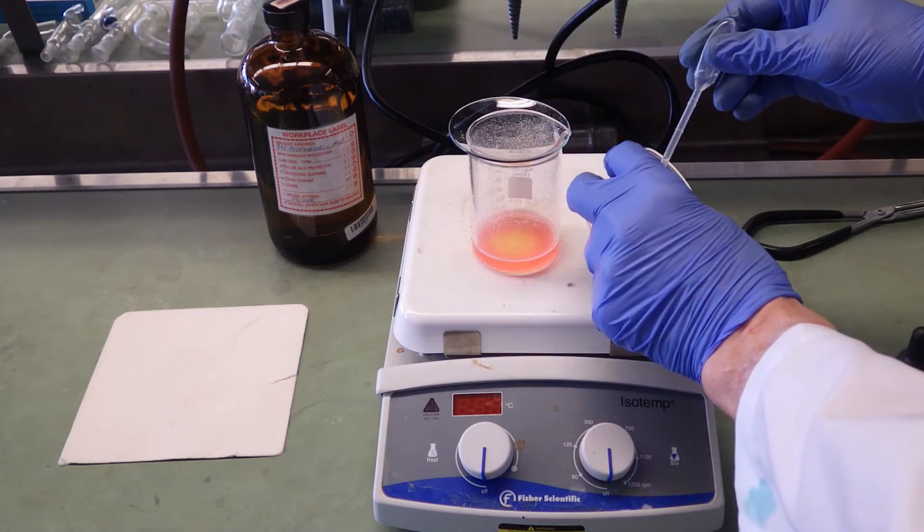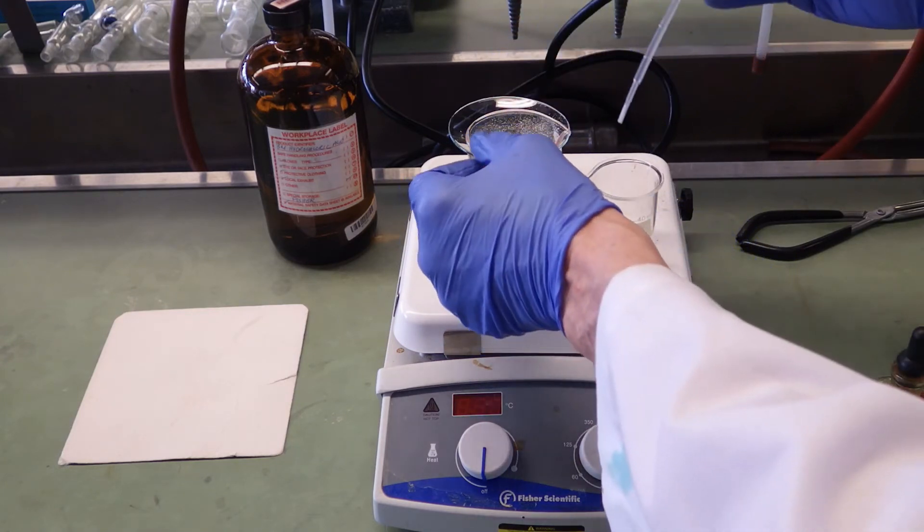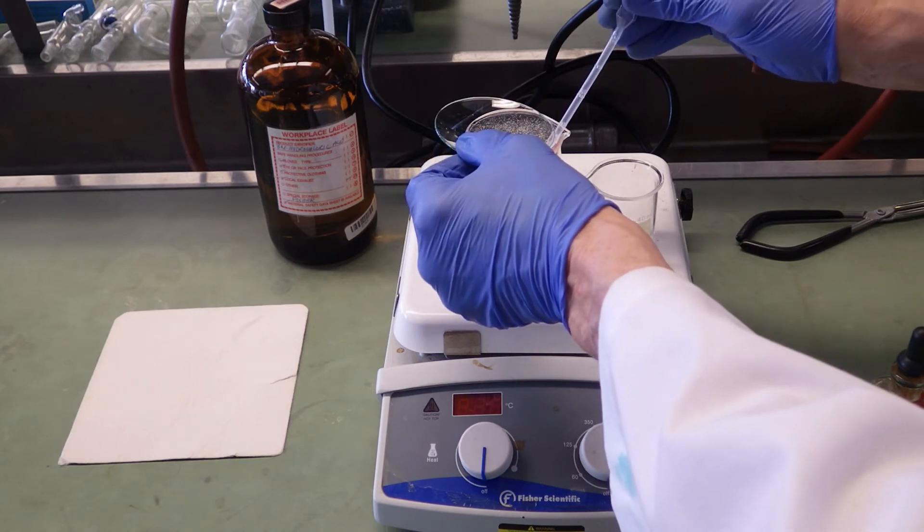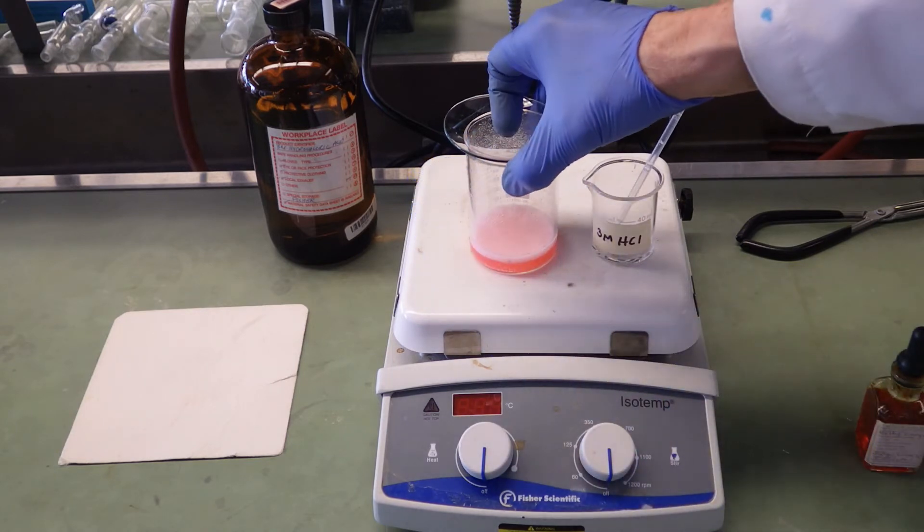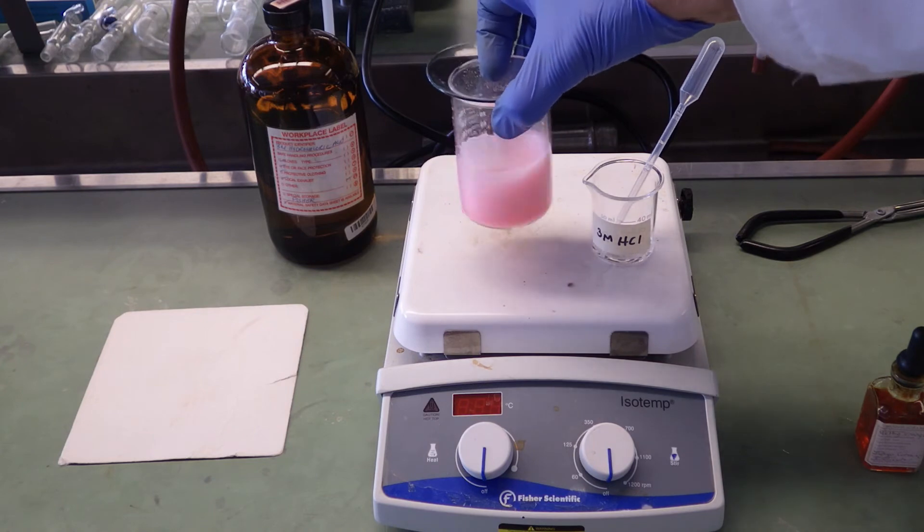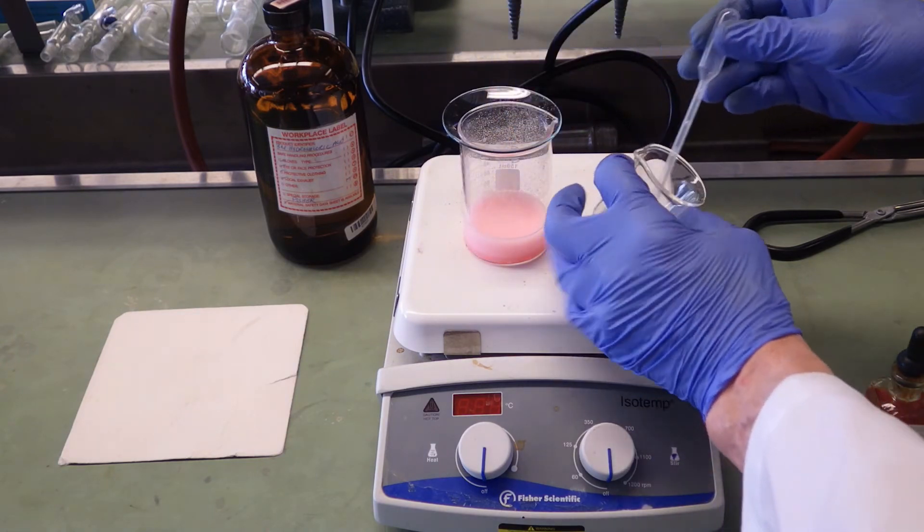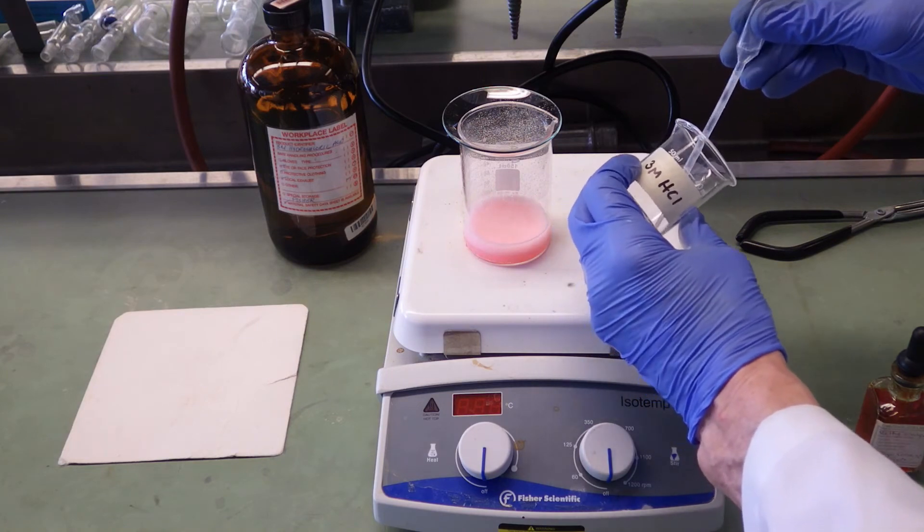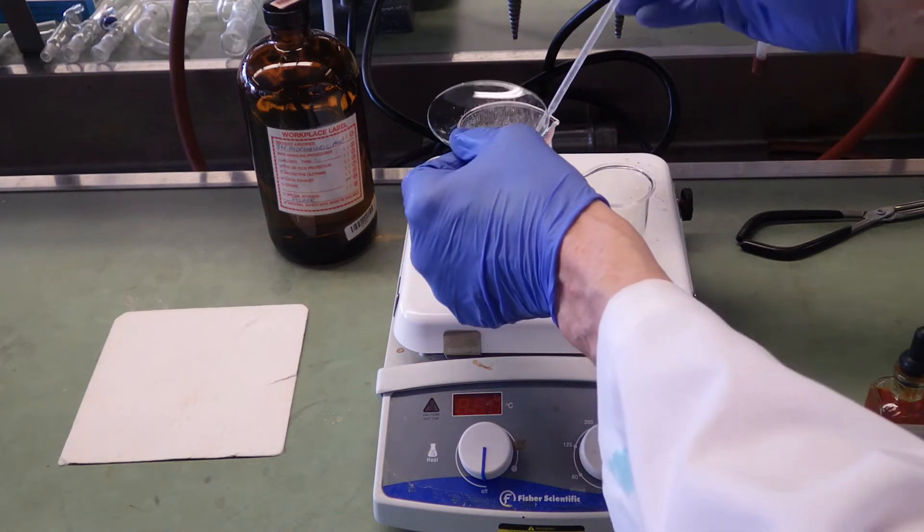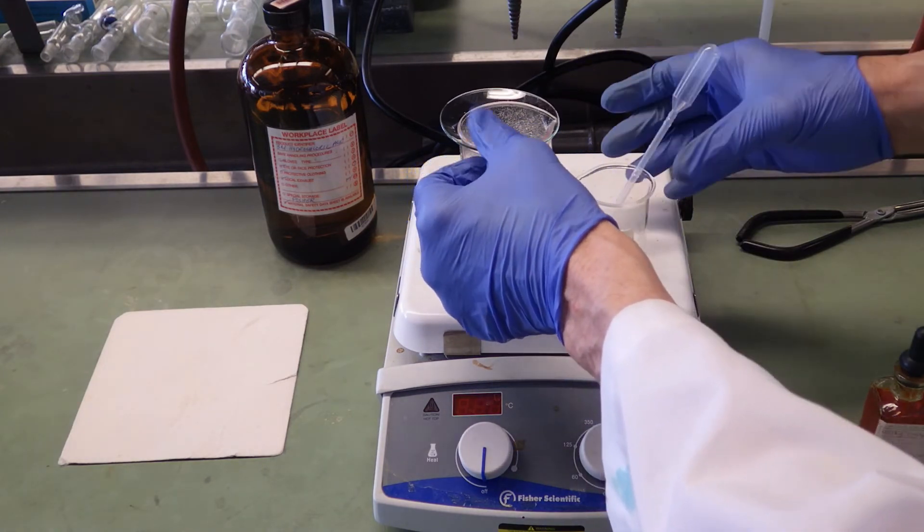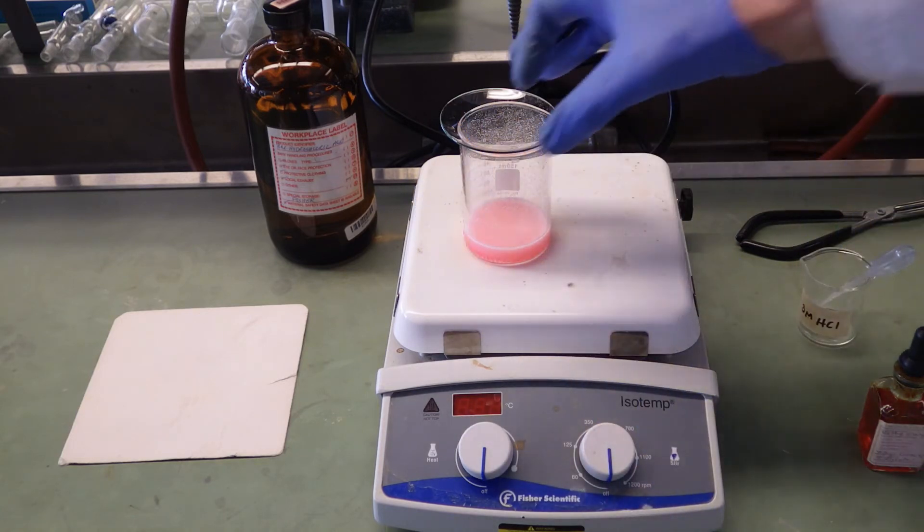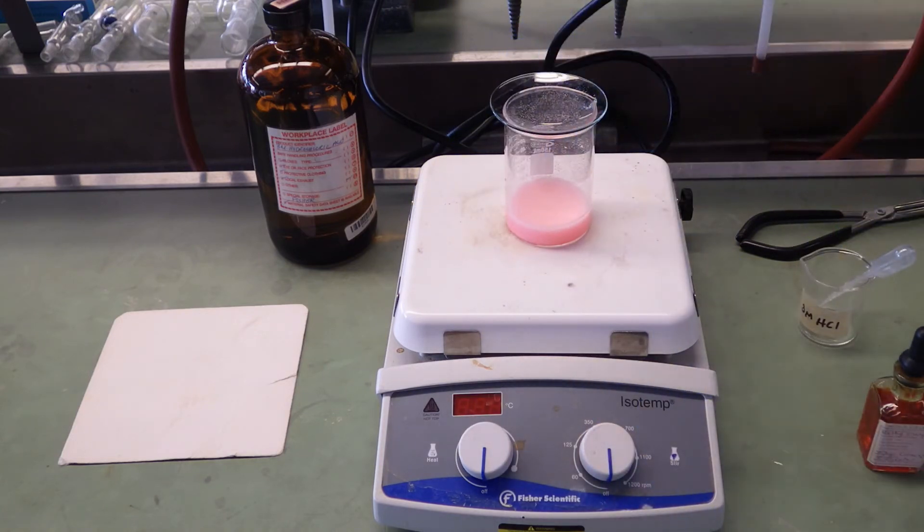Looks like we're just about there. Okay, looks like it's staying red. So there's the last of the HCl. It's present in excess. All our sodium bicarbonate should be completely converted to sodium chloride, water, and CO2 at this point.